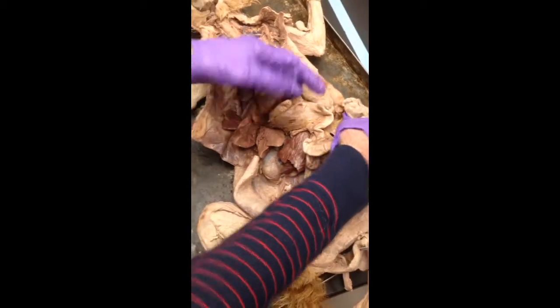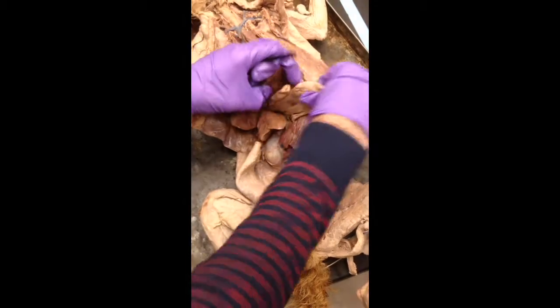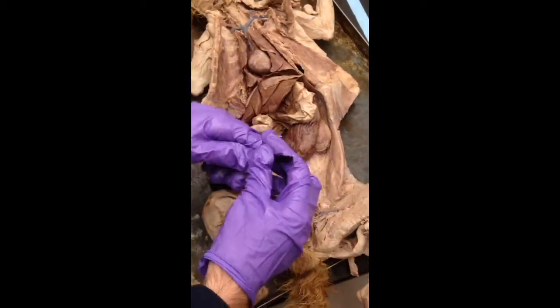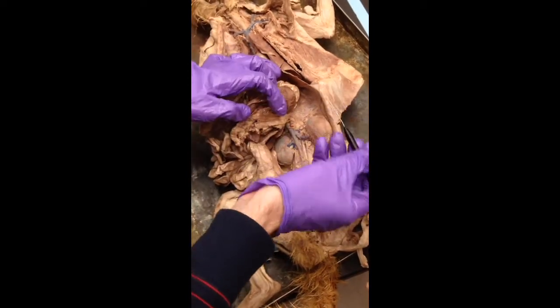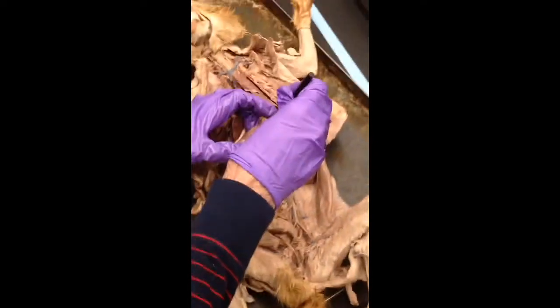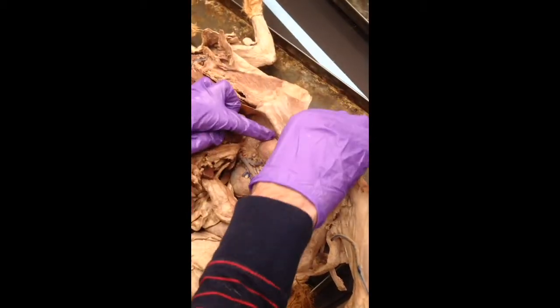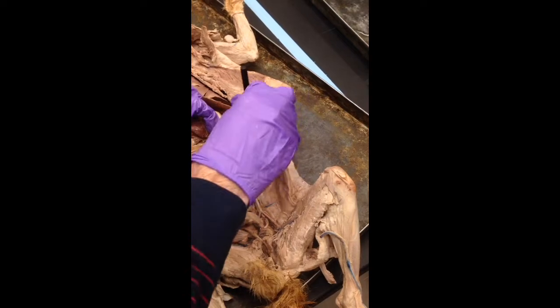And I know everybody expects the pancreas to be something like an organ, but it's just that. However, it's very not good when something goes wrong with it. Well, that and pancreatic cancer isn't exactly the best cancer to have either. That's the spleen. There's a kidney.